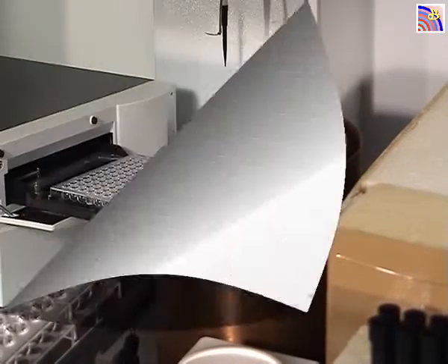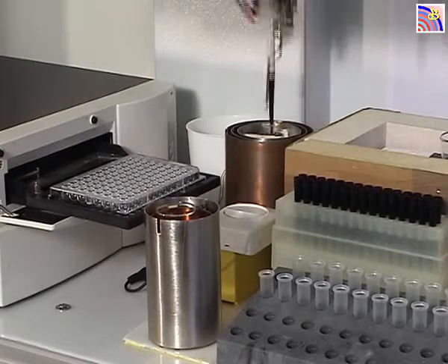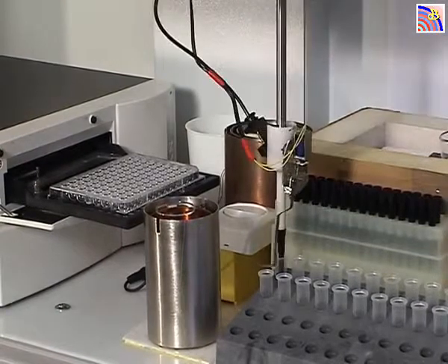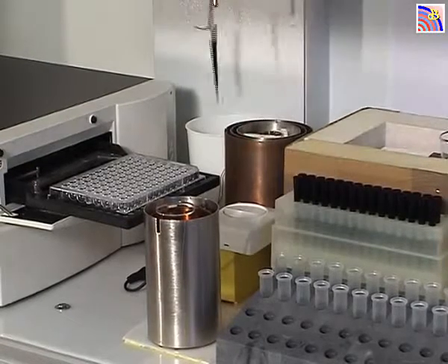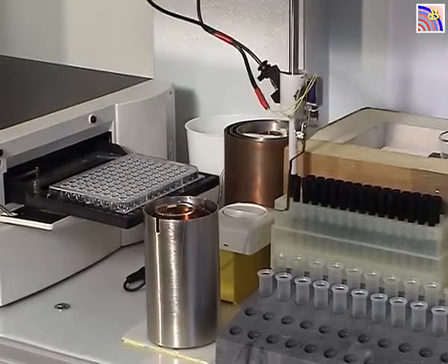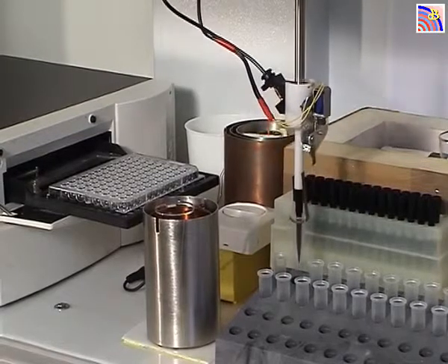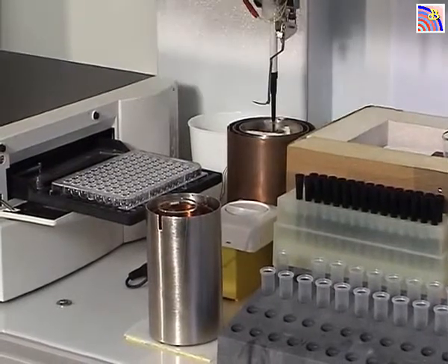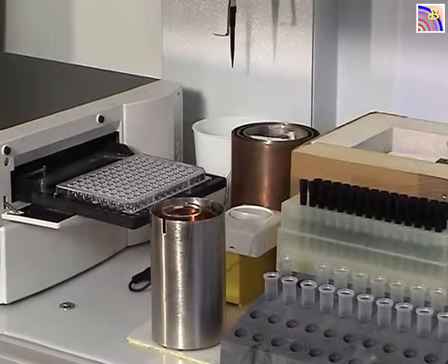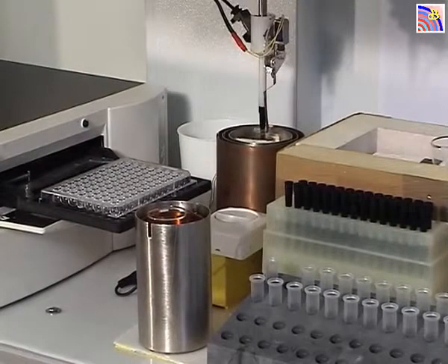We have obviously skipped the 5 minutes, and the machine will now take another tip, get this tube with the informed water, and put it back in place. Then it will collect a second tube and do exactly the same. Now water is being dispensed into the tube — 5 minutes, another signal — and these signals are placed blind; they are coded by the computer.